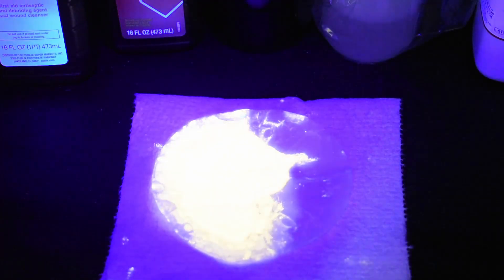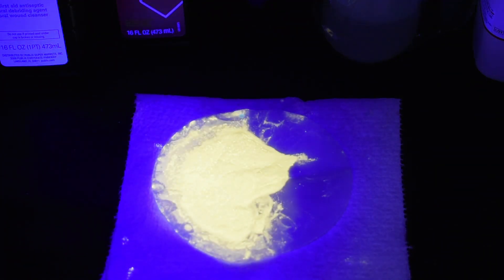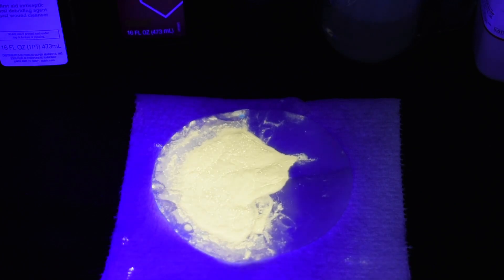Here we are with our final product, and I have my UV flashlight here. I have the product in my chemical cabinet with the doors just cracked a little bit open so the camera can see, so we get a nice display of the fluorescence, if there is any, hopefully. So I'm going to turn on my UV flashlight, and you can see a little bit on the hydrogen peroxide bottle in the corner. I'm going to shine it on the compound, and hopefully we get a nice fluorescence. Oh yeah! Look at that! That's amazing! Look at that yellow!